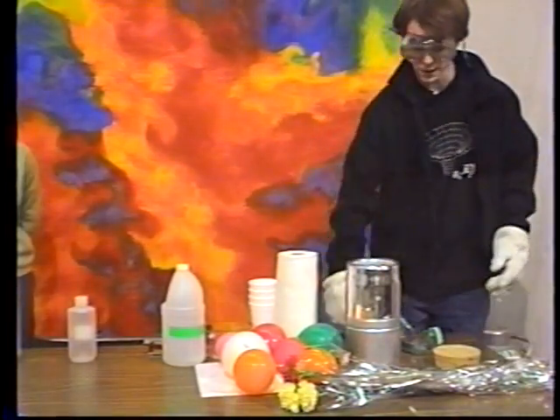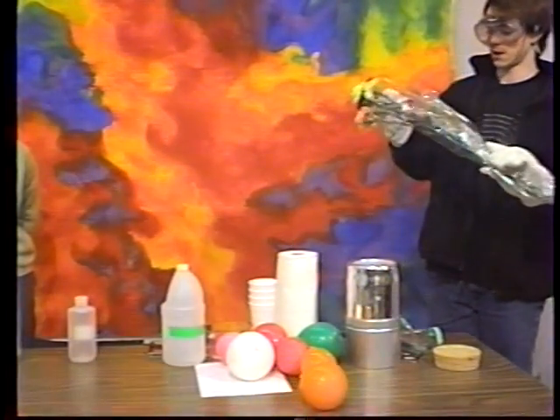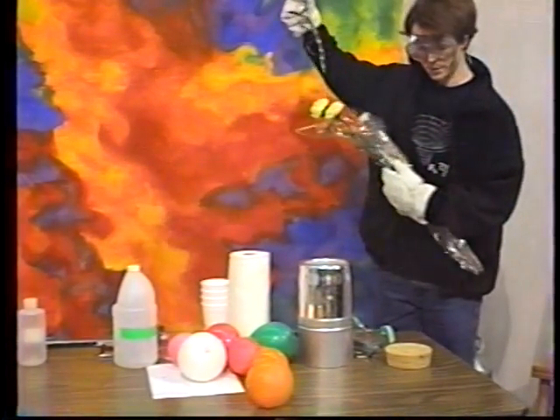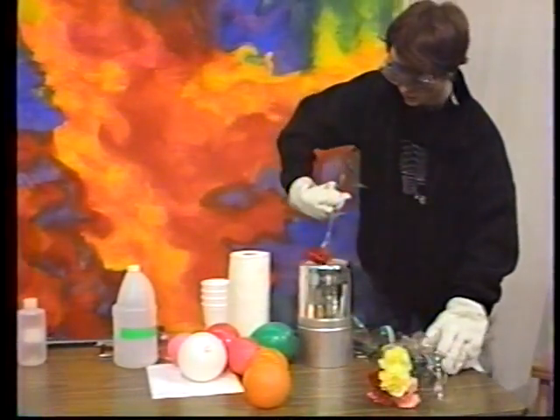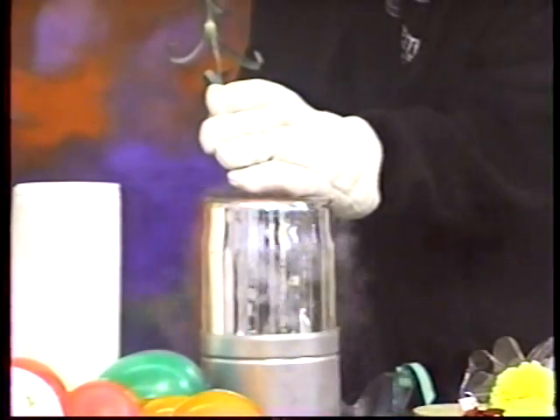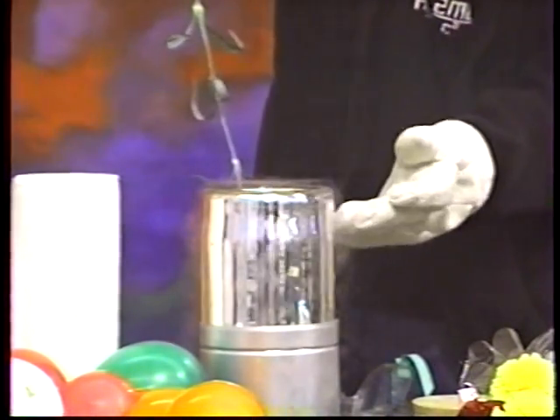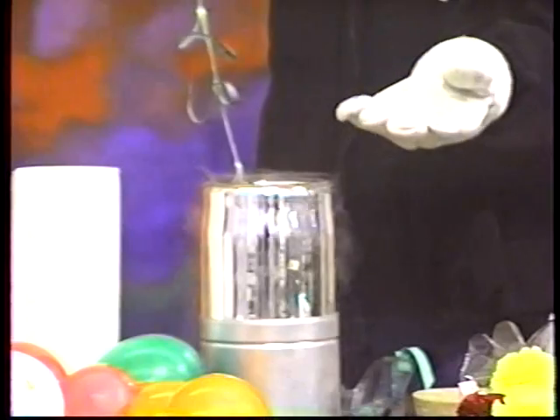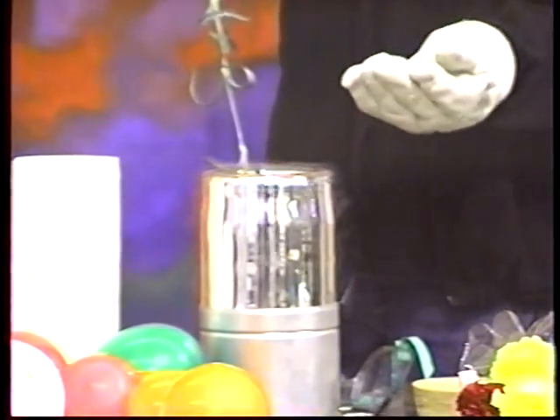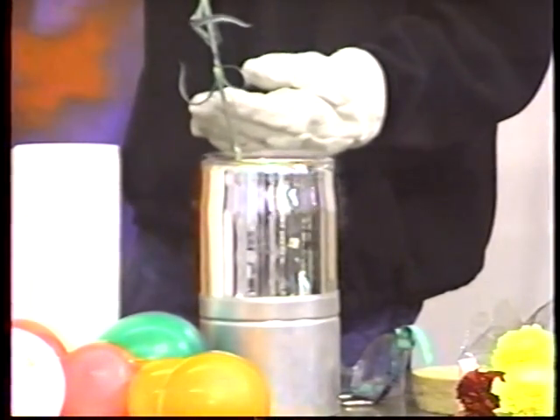We've also got these flowers here. And we're going to see what happens to the flowers when we place them in liquid nitrogen. Now, I don't know if the mic picks this up, but the liquid nitrogen actually boils when we put the flowers in. Now the reason that happens is because the flowers, again, are at room temperature. So when we put it into liquid nitrogen, the liquid nitrogen is actually boiling because it's above its boiling point. So we'll let that cool.